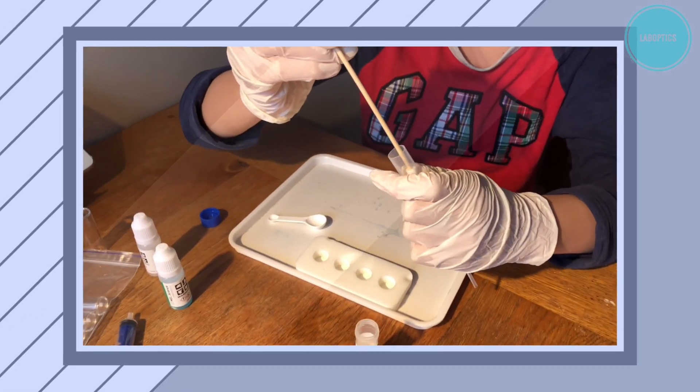Then we will fill the cut pipette with resin up to the 2.5 mark and then put another cotton cylinder on top of that resin.